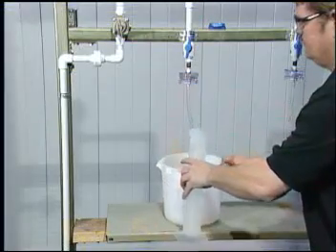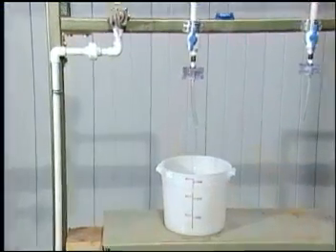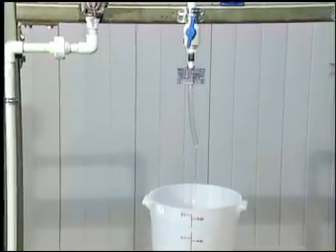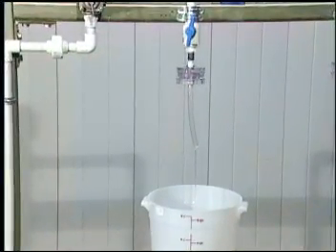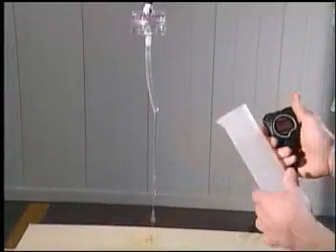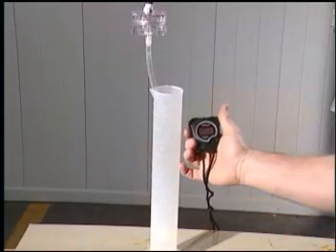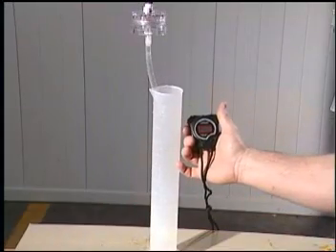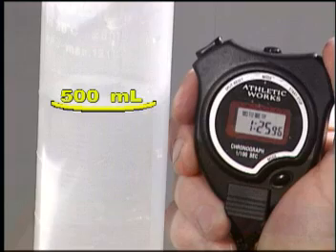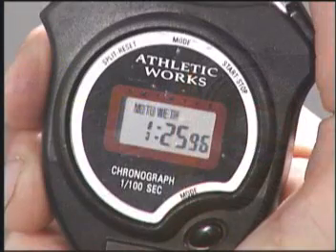The sample stream continues to pass through the filter for a total of 15 minutes. At the end of 15 minutes, the operator again places the 500 milliliter graduated cylinder under the filter holder and again determines the amount of time it takes to pass 500 milliliters through the filter.